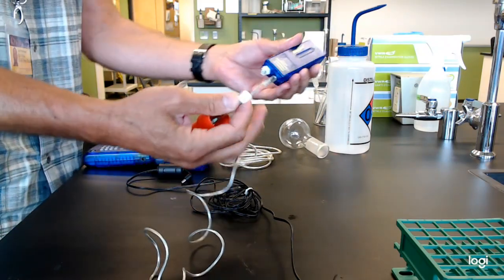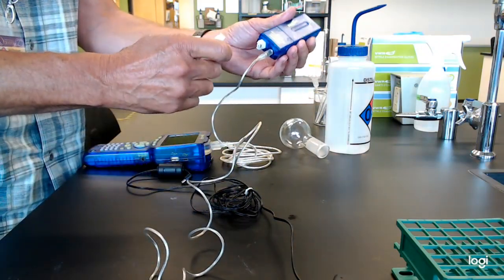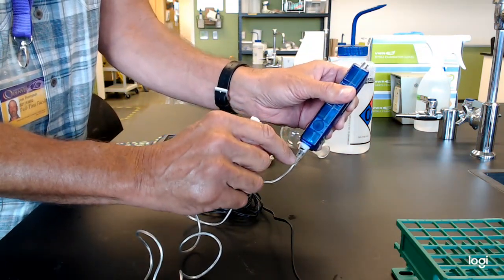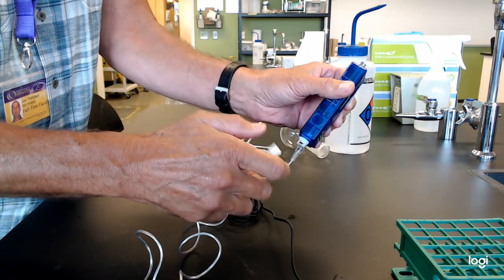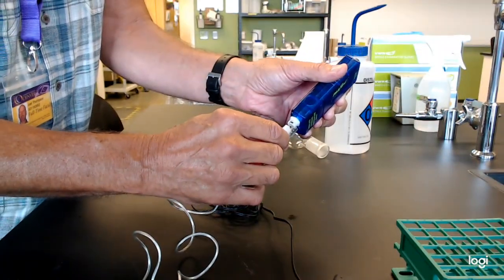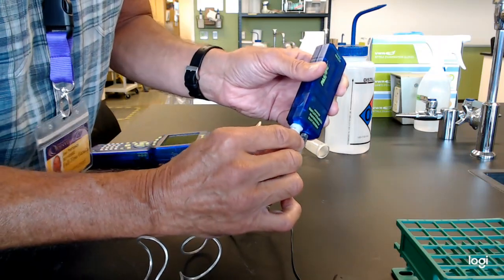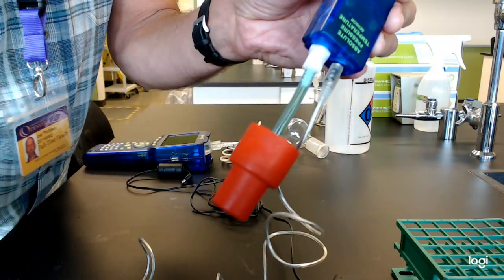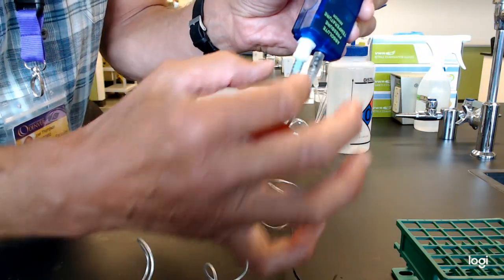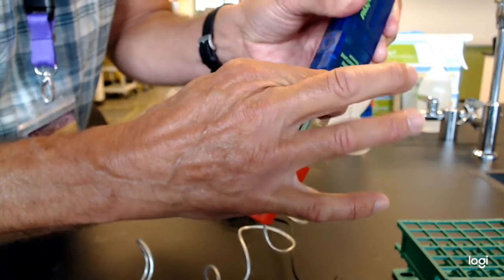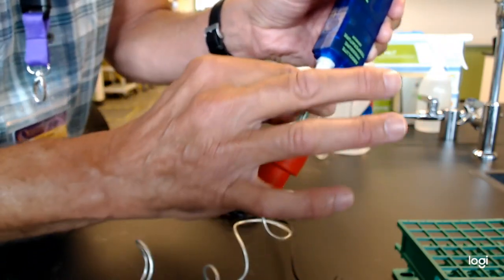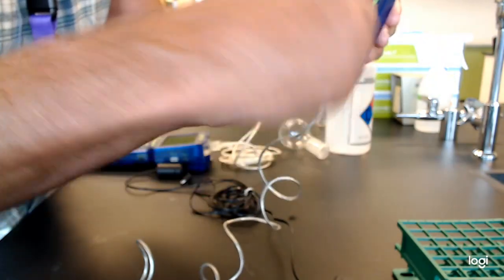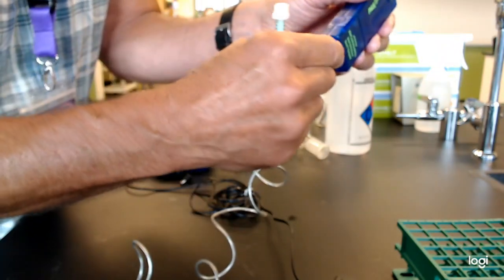The way the pressure sensor works is there's a little O-ring in here, and that's actually what makes the airtight seal. It is not a screw thread, it's actually an O-ring thread. So when you get it right, you push it on and you'll hear it lock. When you need to take it off, you give a slight pressure in and you'll hear it unclick. It's important that you understand that idea because you don't want to try and unthread it or you'll break this seat here.